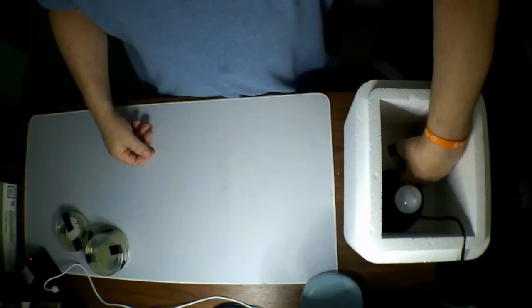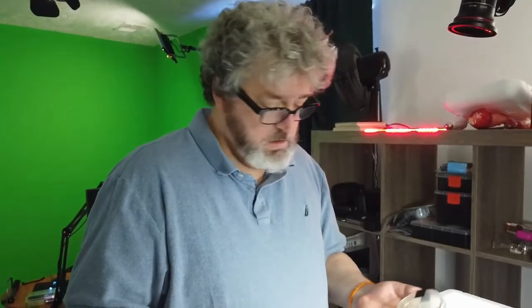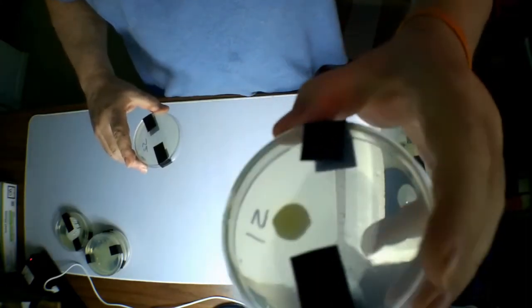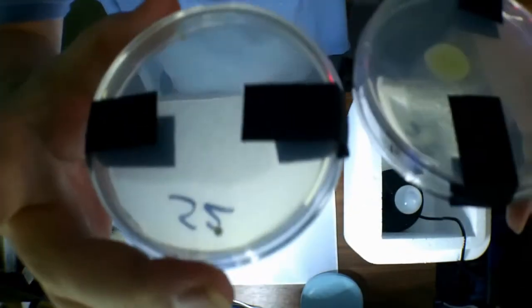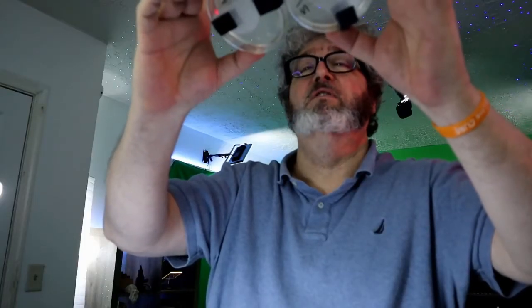Alright, what's next? Next should be screwdriver. Screwdriver 1, we have one big spot right there. Do you see the bloom? Screwdriver 2, one tiny spot right there. So if we look at area of coverage, I would say that's probably about a 90% reduction in the overall amount.